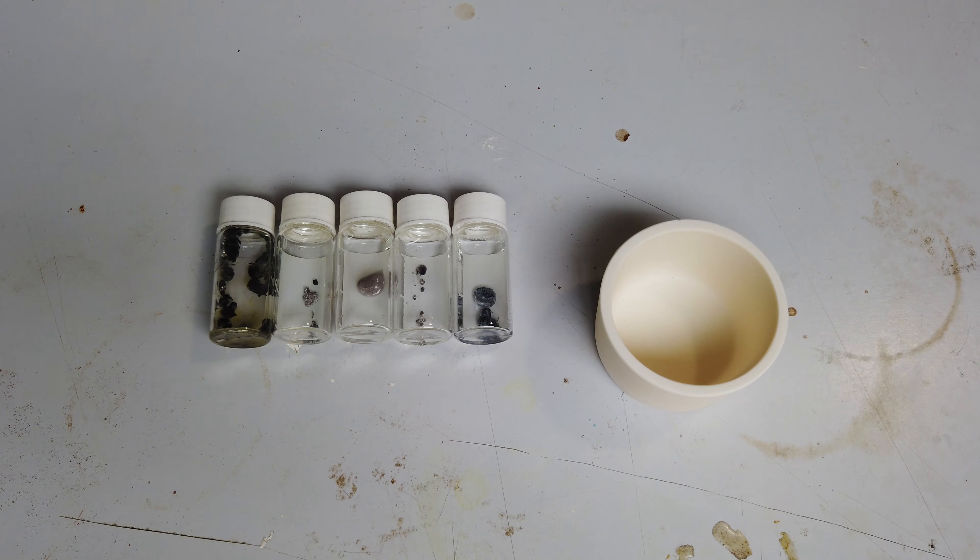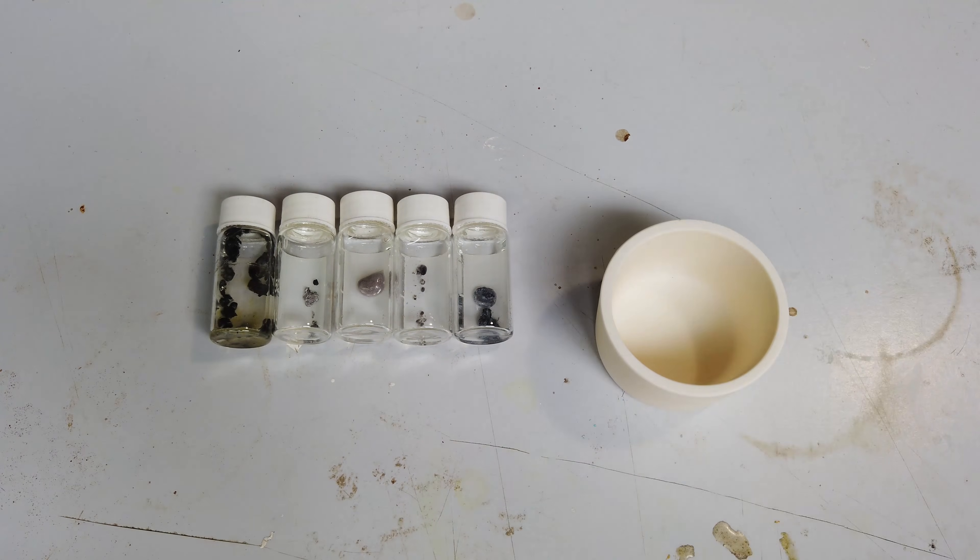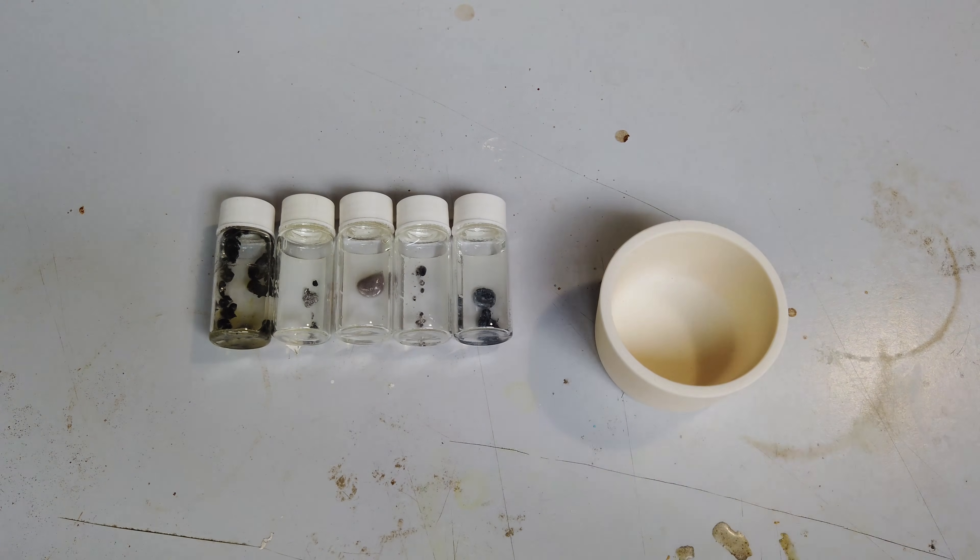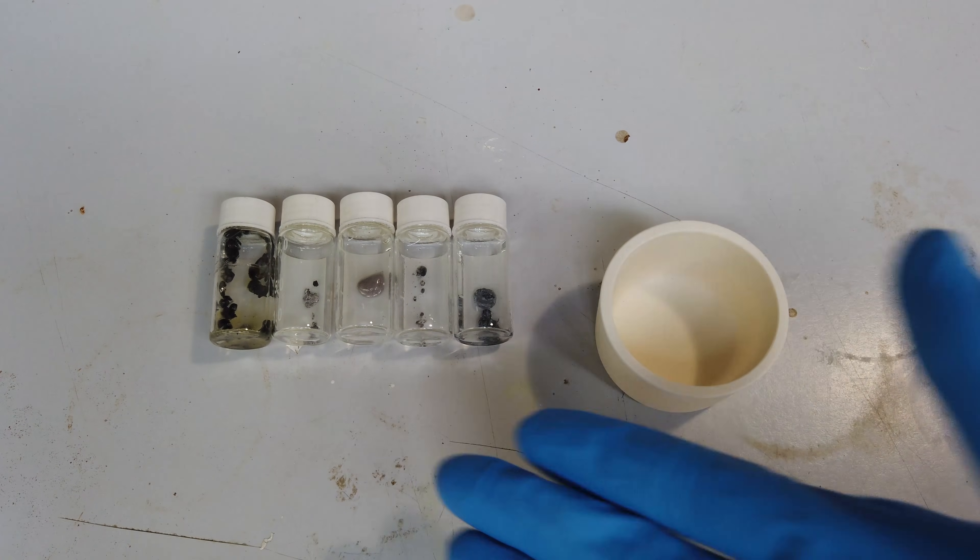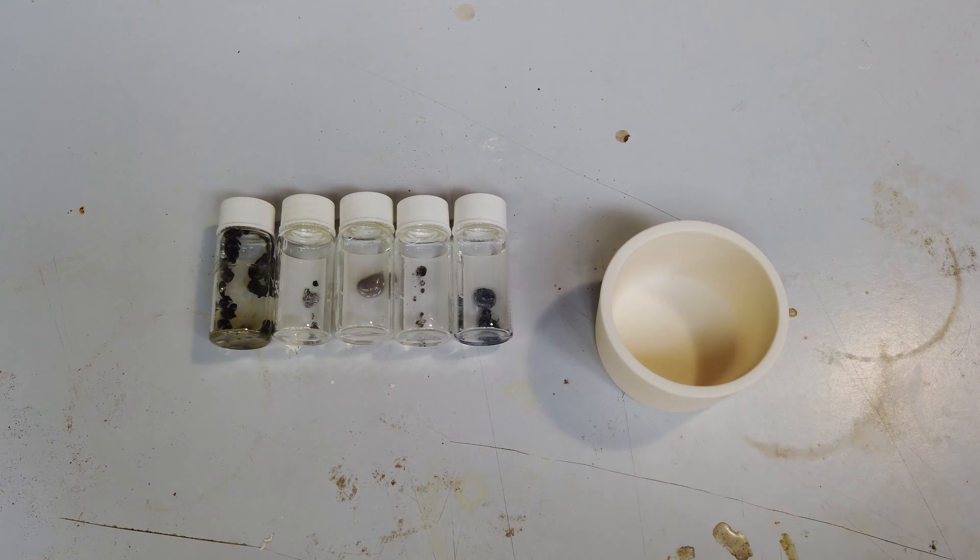The basic idea is we're bringing back the Molten Salt Electrolysis series to Scrap Science. It has been more than a year since my last video on Molten Salt Electrolysis, so if you don't quite remember, the goal here is to make metals by Molten Salt Electrolysis procedures.